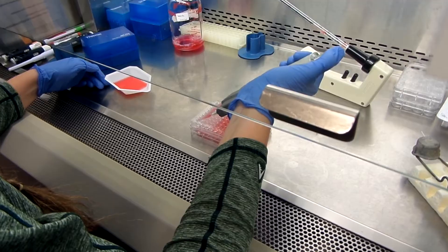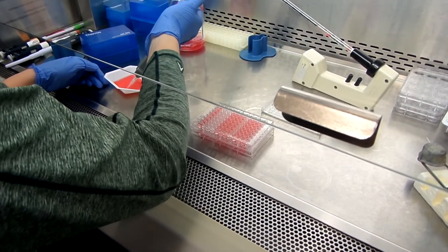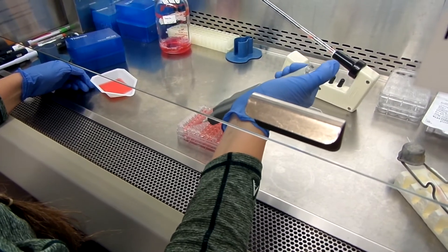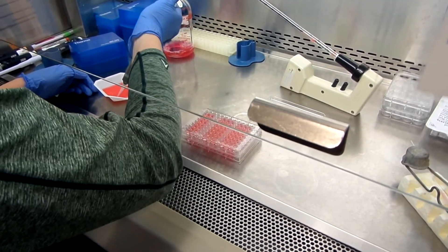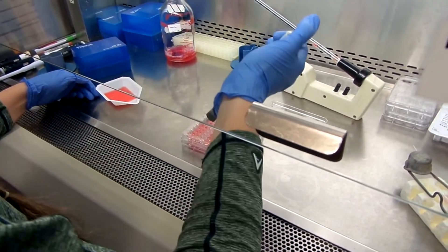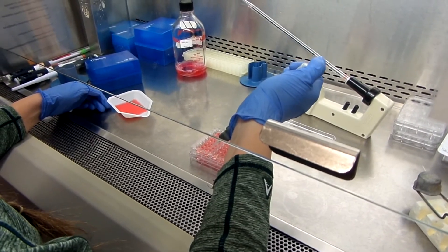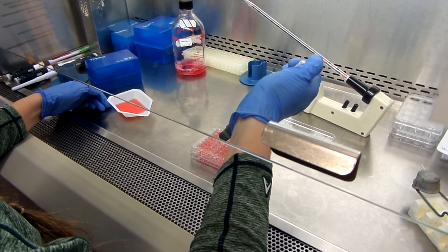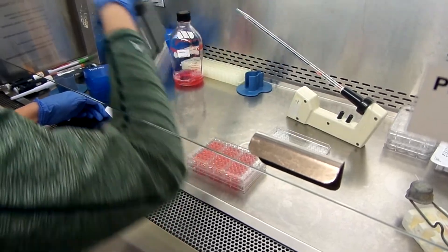With the multichannel pipette, Sydney is adding the MTT salt to 8 wells at a time, and she will finish doing this for all the wells in the 96-well plate.